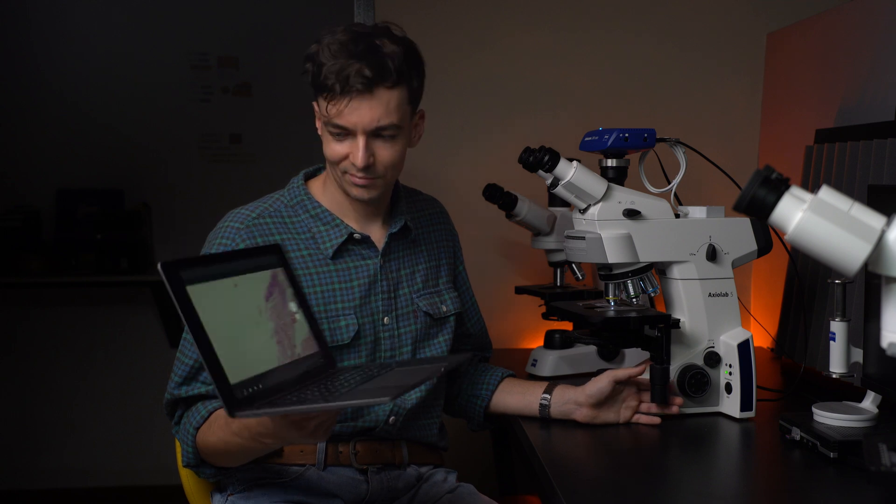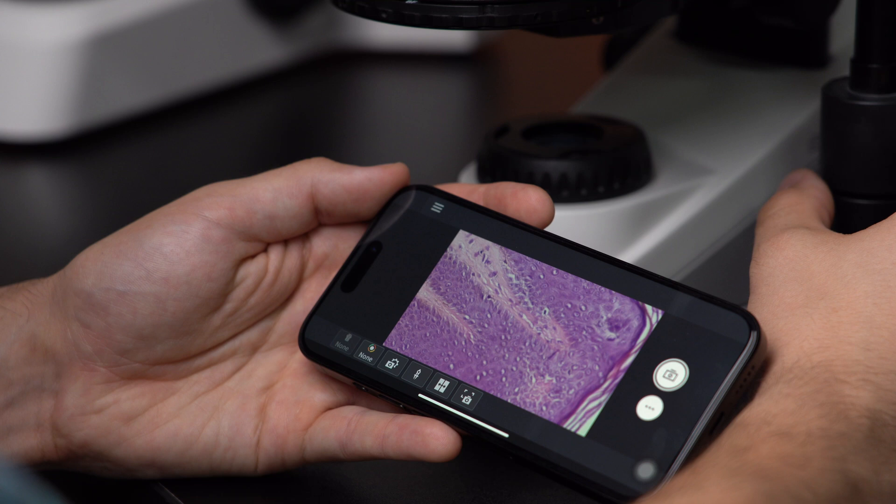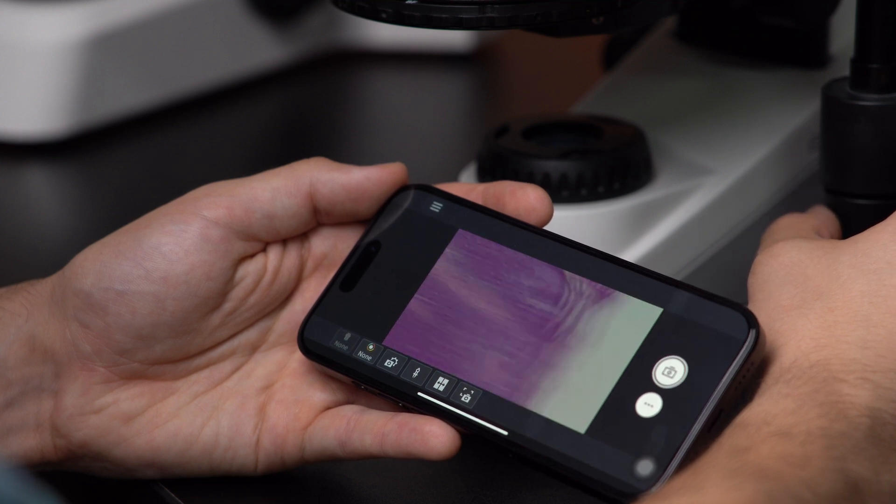Sometimes it's very important to provide a wireless connection between the microscope and your workstation. If you're working on a laptop or want to connect your iPad or Android device to the microscope, the easiest way is the Wi-Fi connection.